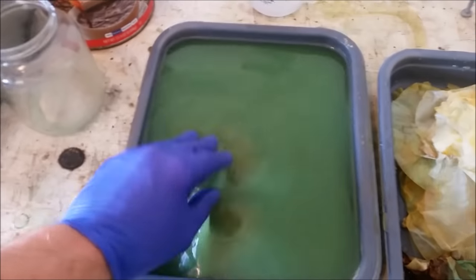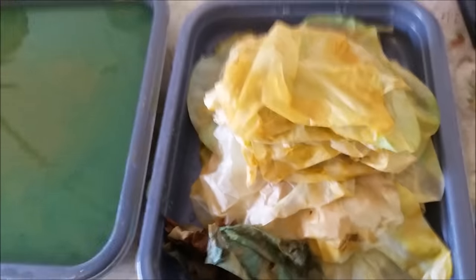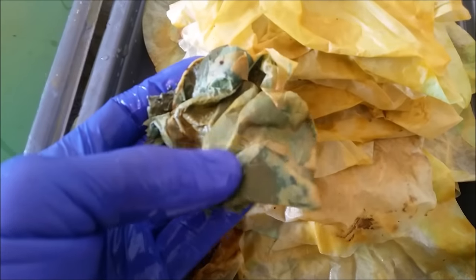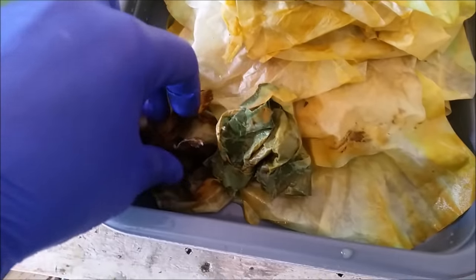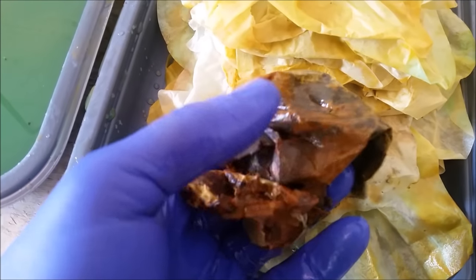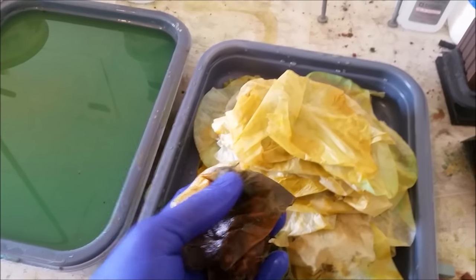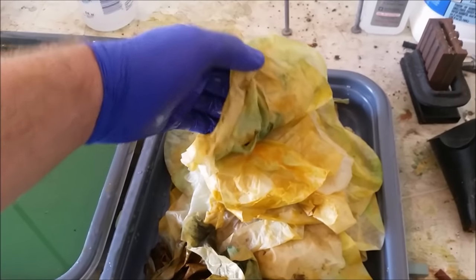I had finished rinsing these filters off — there's the pile right there. As you can see, they're not perfectly rinsed; you're not going to get these filters completely clean. Some of them are really bad. You can tell there's still what looks like some copper oxides and maybe some carbonates — pretty much the stuff that is non-soluble in water. Sometimes that really fine particulate you get when electroplating and growing crystals is barely trapped by the coffee filter, so getting it out once it's trapped is kind of a pain.